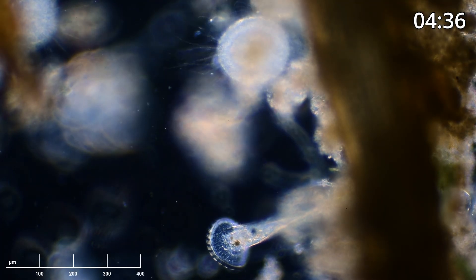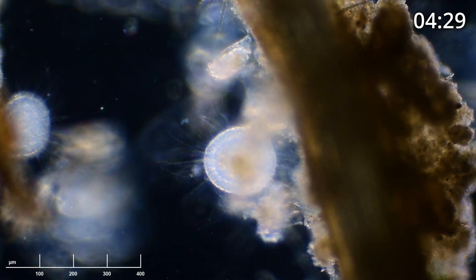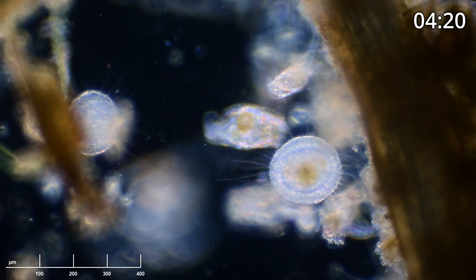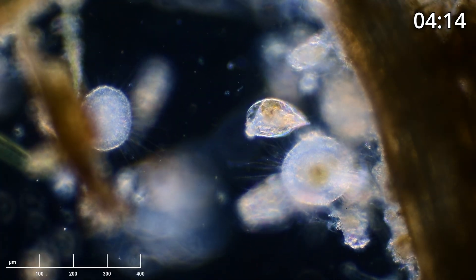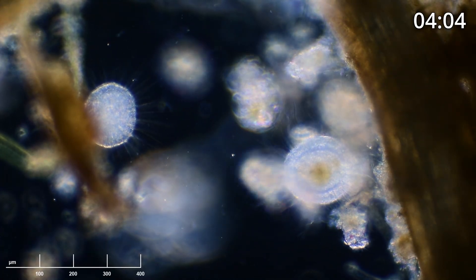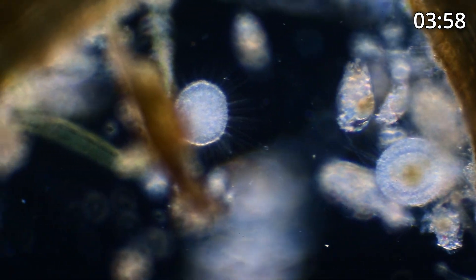You can see it's twisting and giving us a look right inside the bell, right inside its oral opening. This heliozoan's axopodia — the rigid hair-like structures — have taken a beating from the rotifers crashing into it. The one on the left has taken less of a beating and you can see much better the real symmetrical sun-like axopodia sticking out of these heliozoans. These axopodia are sticky — a small organism or algae will get stuck and then it brings them in, absorbs and digests them.